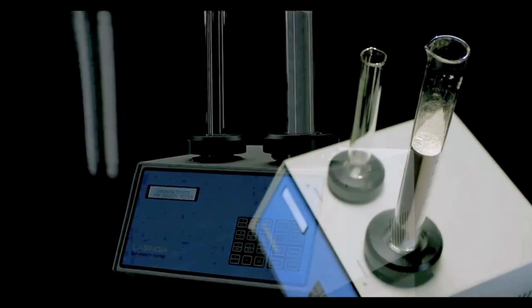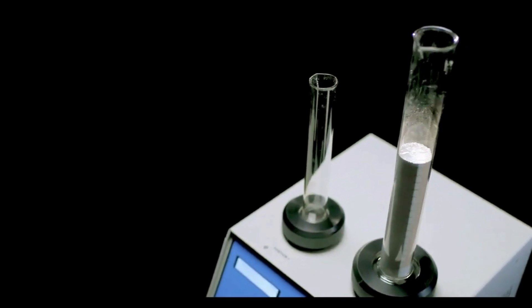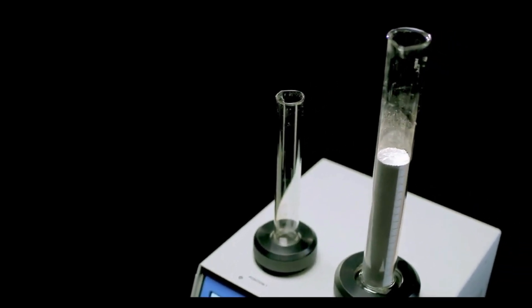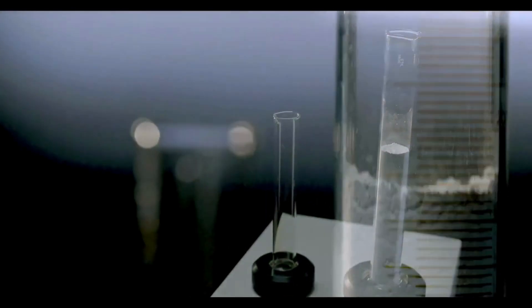Press the start key to start the test. The display will now show the elapsed taps. After the test is complete, calculate the tap density using the final volume observed.